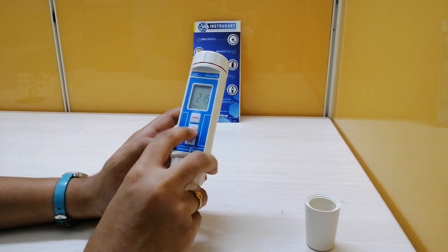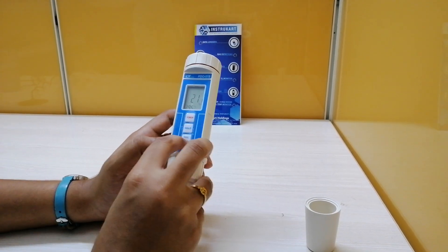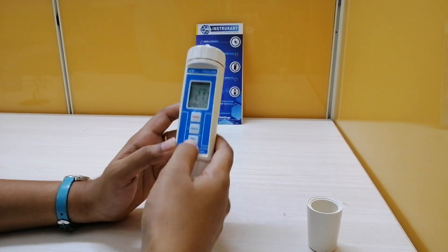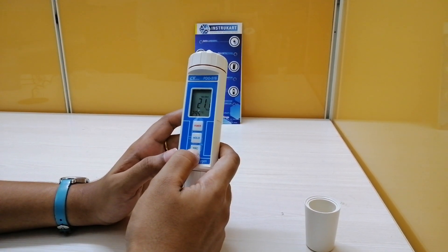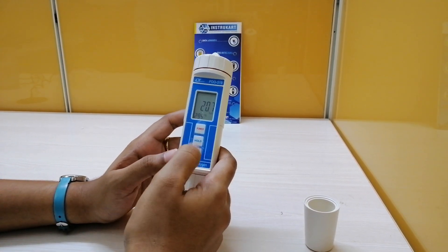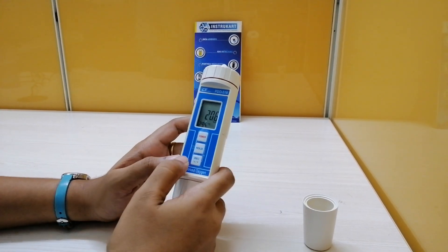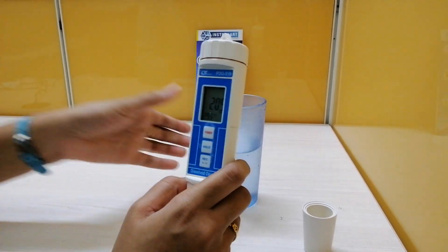Let me hold — the value is frozen here. Pressing the record key shows the maximum value recorded, and this is the minimum value recorded. Let me try pressing it long — the record function is disabled.